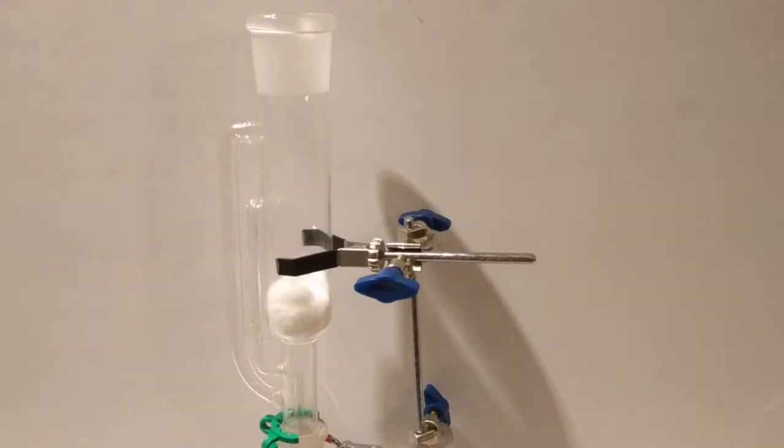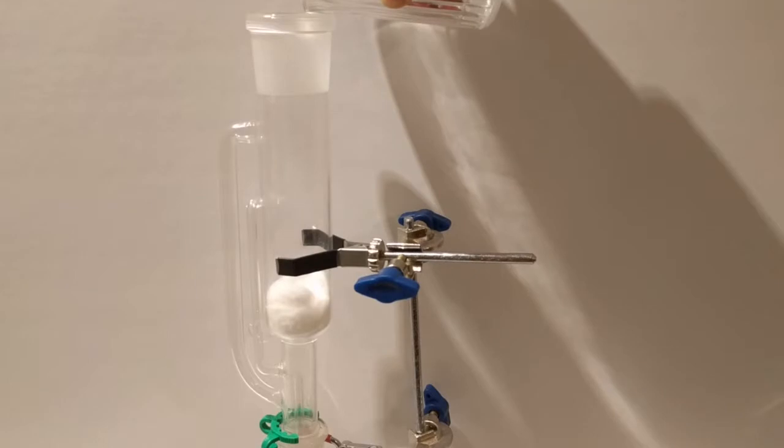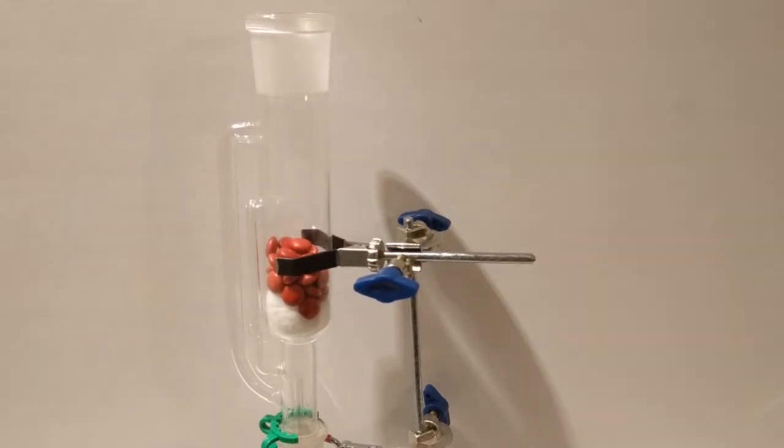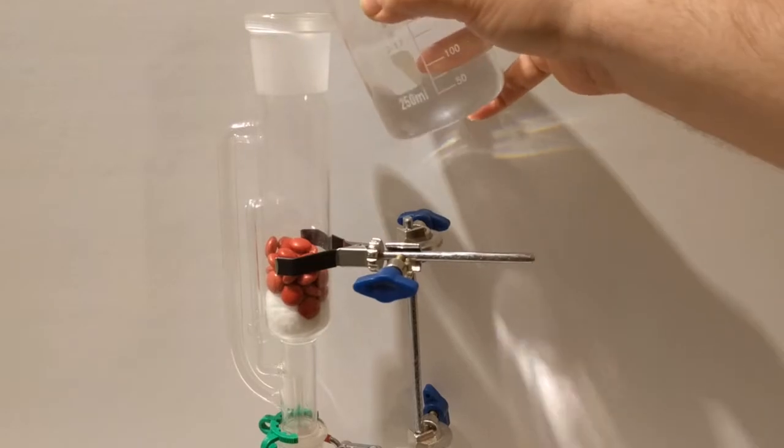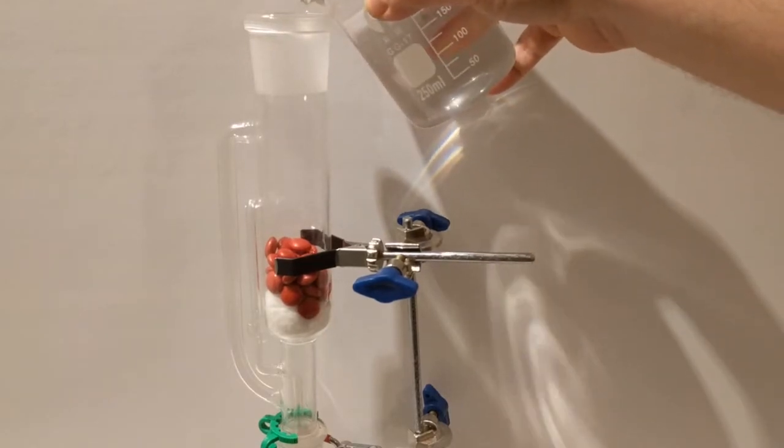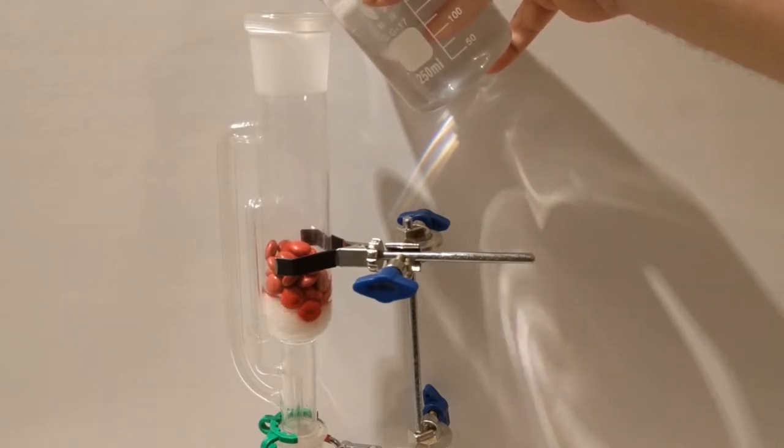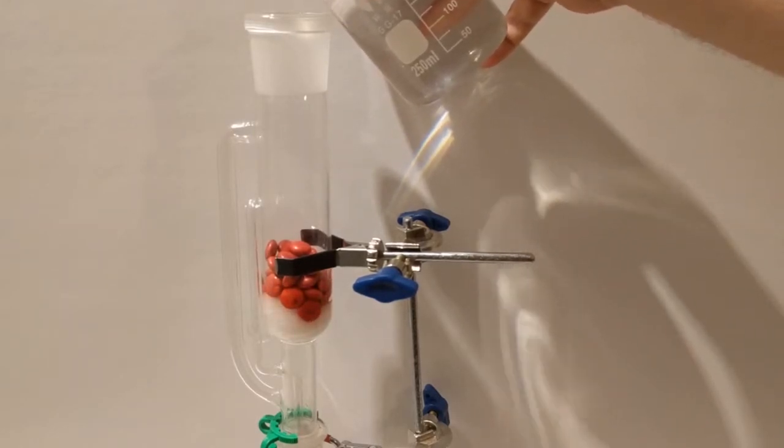I'll be making my limoncello using a beautiful piece of glassware called the Soxhlet Extractor. Quite a tongue twister. I'm going to be demoing it right now with some M&Ms, and I'll be using water to extract their outer shell. This isn't the normal mode of operation for this device, and in a moment I'll talk about what a normal mode of operation is.